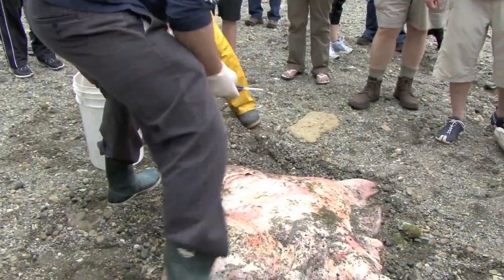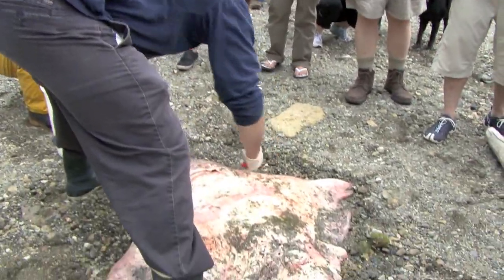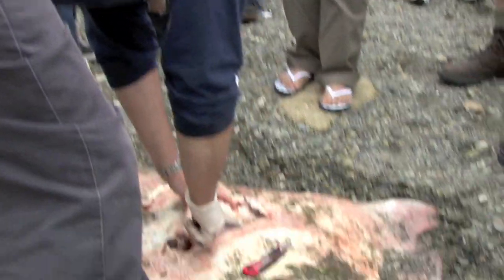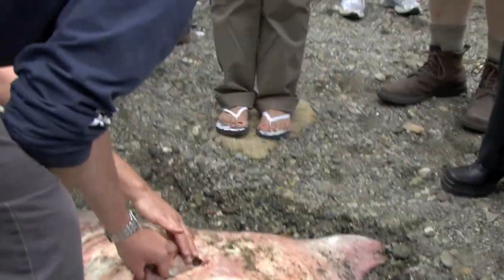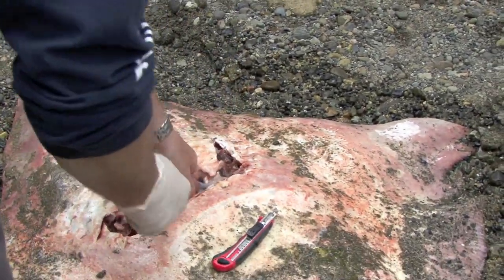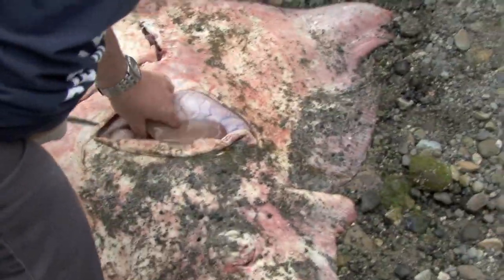Normally I would do this with a great big post-mortem knife, so we're going to have to just sort of improvise. These guys have a two-chambered heart — ventricle there, atria there — and they have a mixed arterial and venous system. You can see the two vena cava — there's one there and one there. Gills are there.